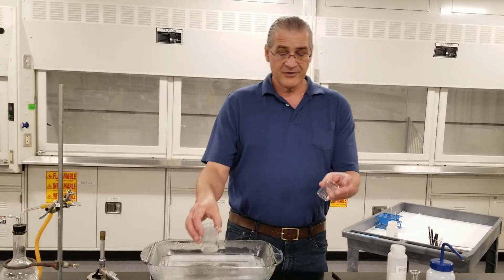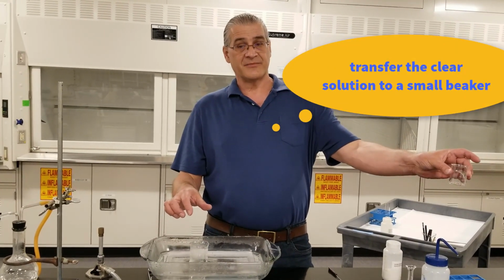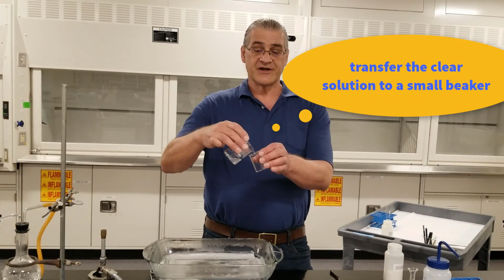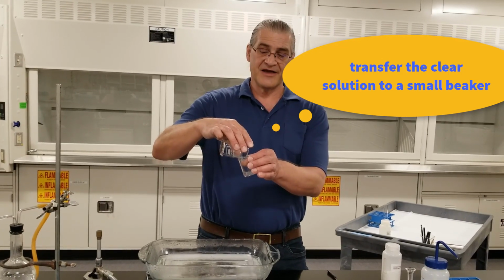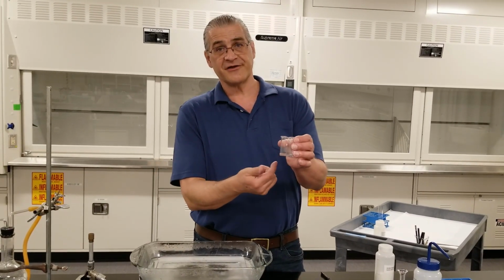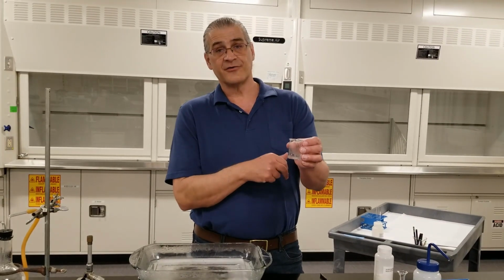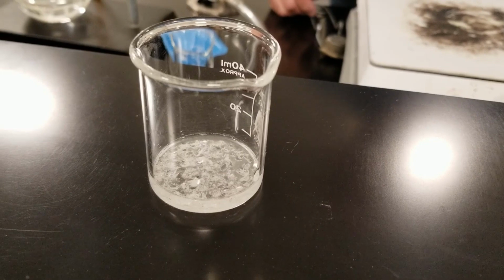So what you want to do is take your small beaker, weigh it while it's empty. Then take your Rochelle salt solution and pour it into here and try and leave any solids behind. So any solids that were in here are left behind, and here is my product. Here's my Rochelle salt dissolved in water. We'll just let this cool off, and hopefully we'll get some nice crystals.